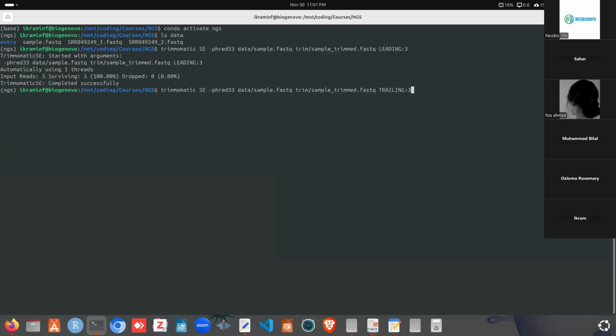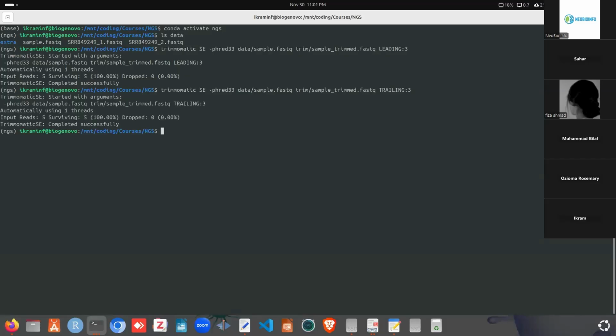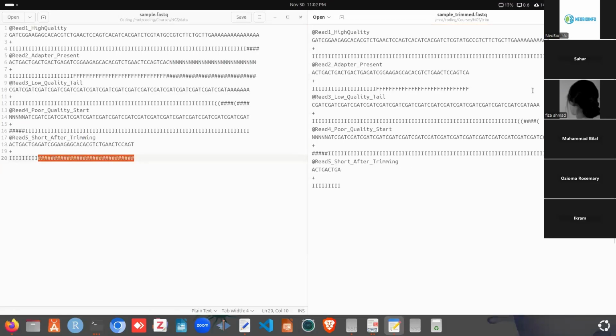We can use 7, we can use 10, we can use higher values like 20, 25. It actually depends on the read or what quality we are expecting. So if we run this and reload this file, we can see the effect in here. It removed what we expected. We can see it stopped at this first bracket, and here it is as it was. For this one, it removed the hash symbol.